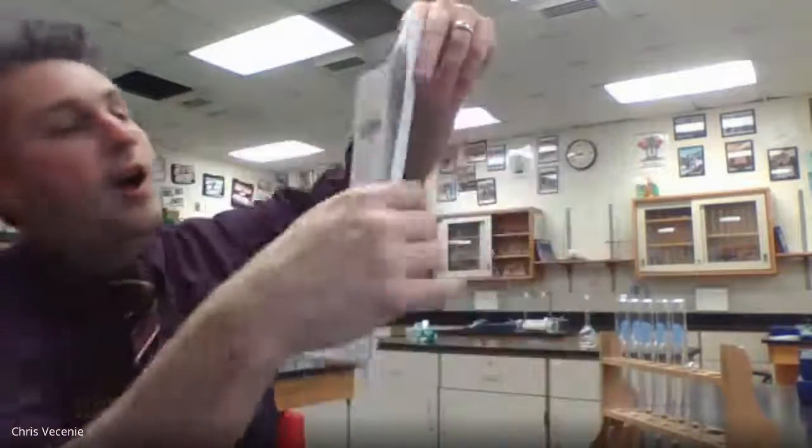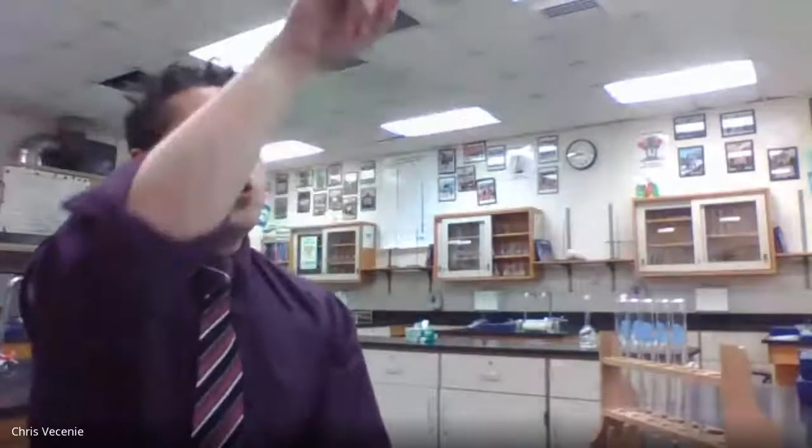Then we're going to physically prep those solutions, and I'm going to measure the absorbances of them. And that's how we create that Beers-Lambert plot, where we get those dots working their way up the graph, and then we can draw the line. Then we'll do some test solutions next, and from that we'll get their absorbance and use that chart to see what their molarity was, which would hopefully let us get our equilibrium constant. So that's kind of the overreaching goal.